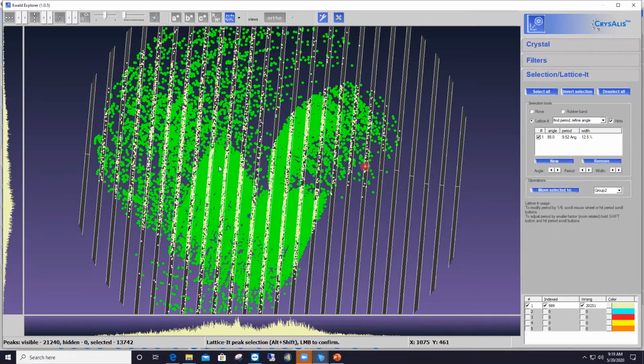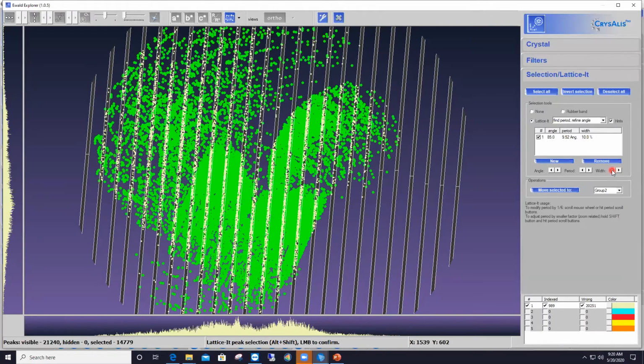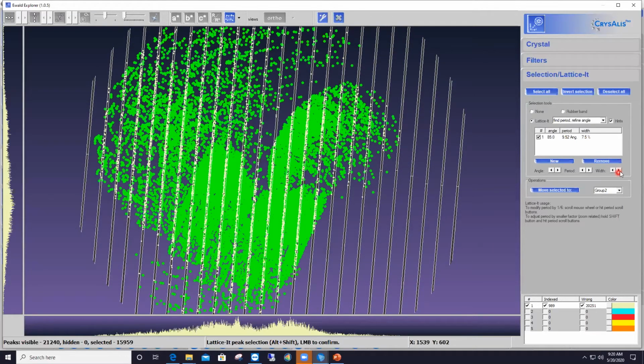So one thing here is that I can maybe make those red rows or red bars a bit thinner, just to get rid of a few more reflections coming from ice. And to do that, I can use the width option on the right hand side panel here, and use these two little arrow buttons, left to make the width smaller, and right to make the width larger. So here, if I click on the left arrow button, I make the rows a little bit thinner.